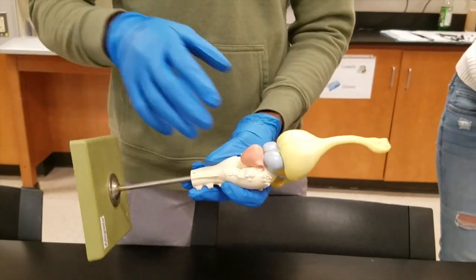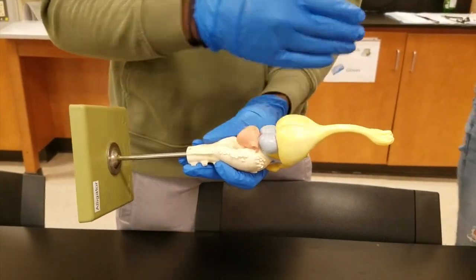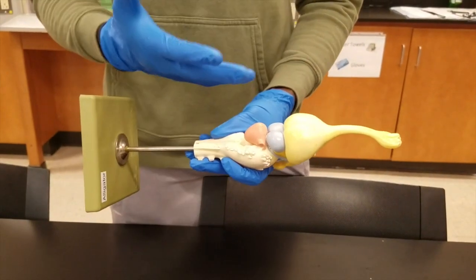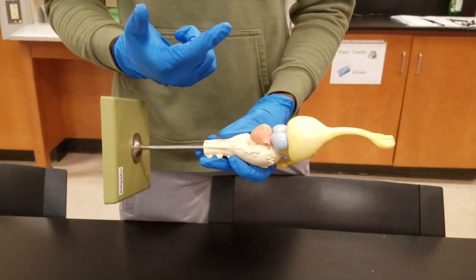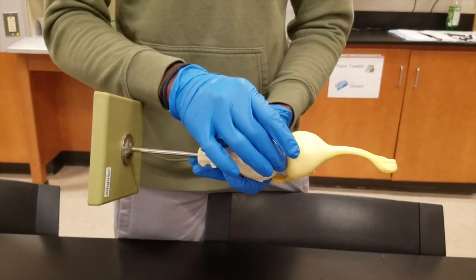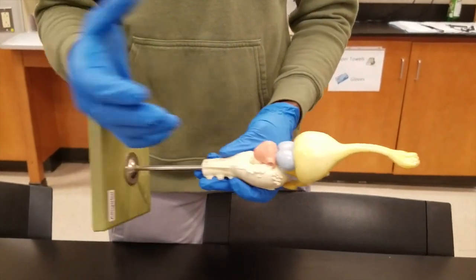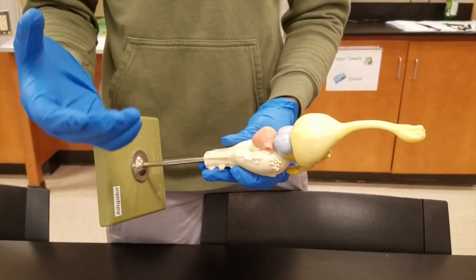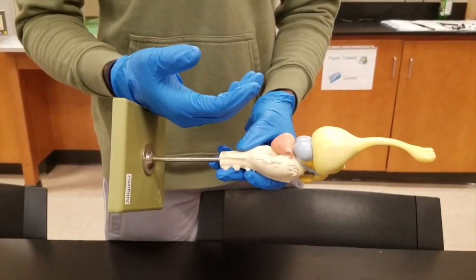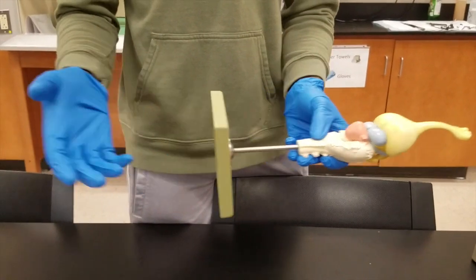The next structure is the cerebrum. The cerebrum is divided into left and right hemispheres and is responsible for the five senses — vision, hearing, touch, and smell. The next structures are the optic lobes, which are responsible for deciphering visuals, and they're really important for animals like turtles so they can look around for predators and find food.